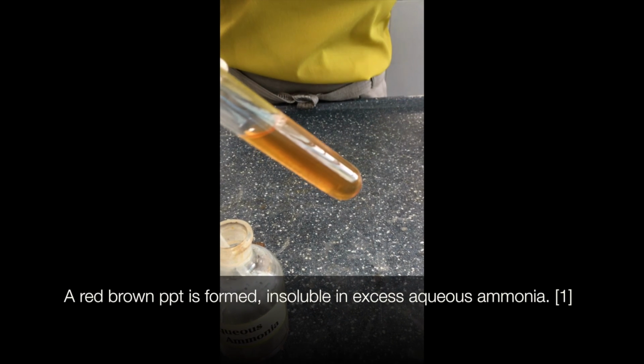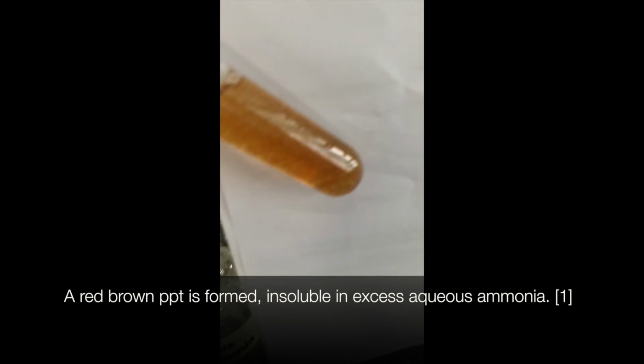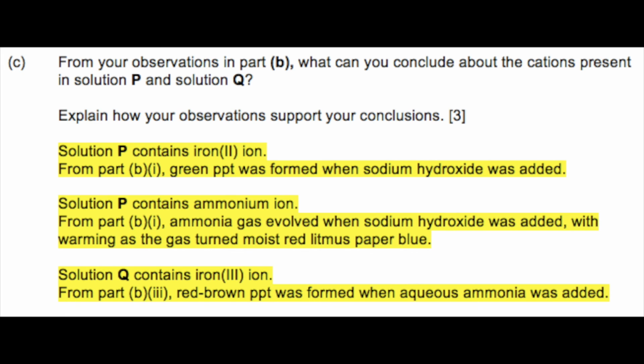So with all these observations of P and Q, this would be the observations and evidences. So solution P contains iron 2 ion as well as ammonium ion, while solution Q contains iron 3 ion. Because what happened was the iron 2 ion was oxidized to become iron 3 ion.